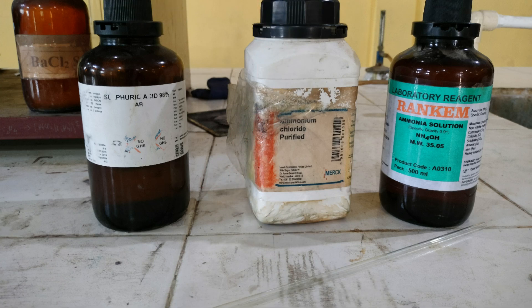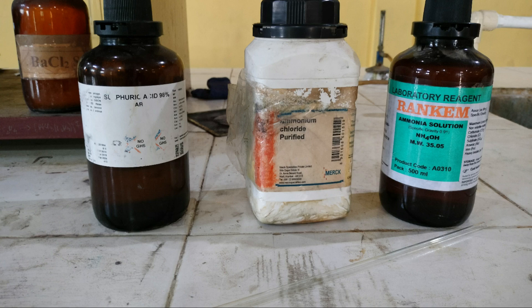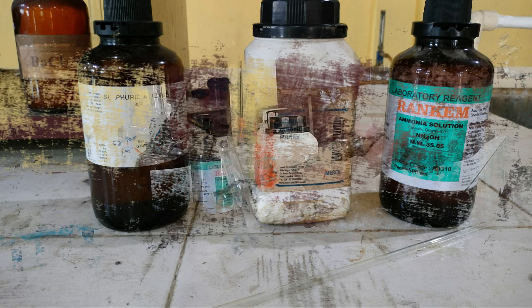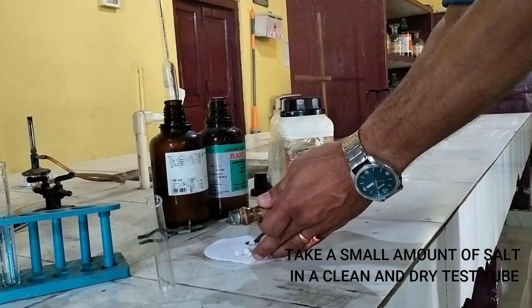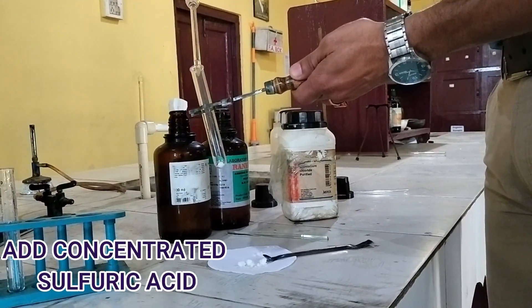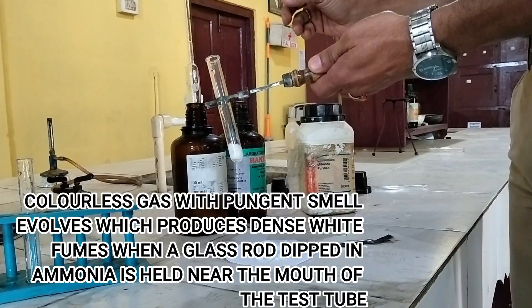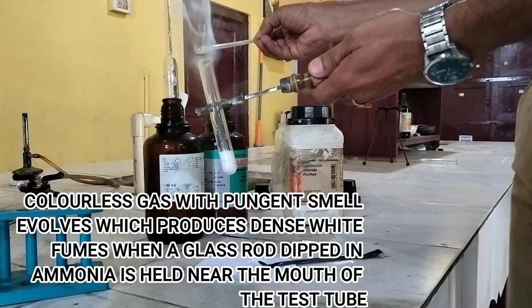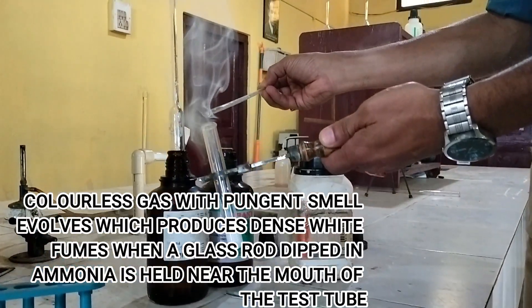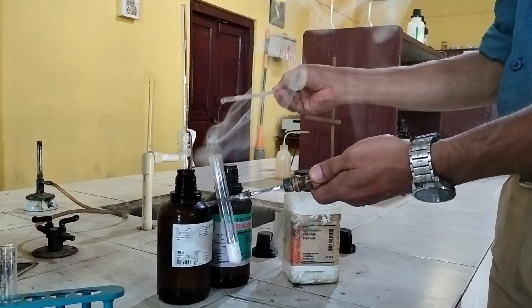For this test, we need concentrated sulfuric acid, ammonia solution, and a glass rod. Take a small amount of salt in a dry test tube. Now hold a glass rod dipped in ammonia solution near the mouth of the test tube. Dense white fumes can be seen.